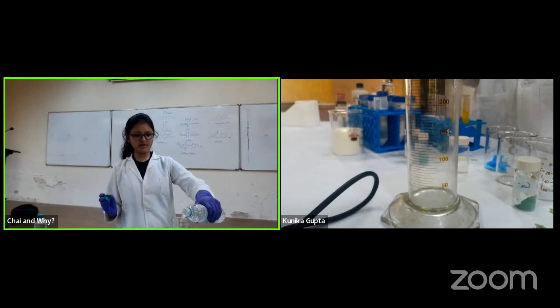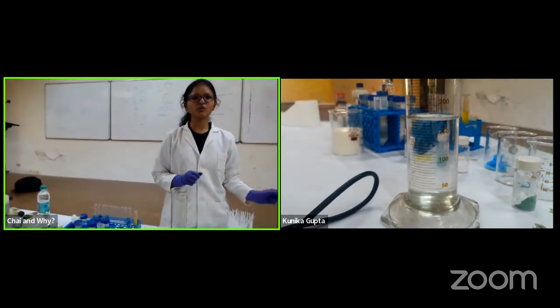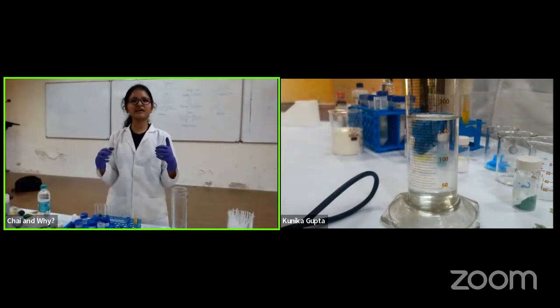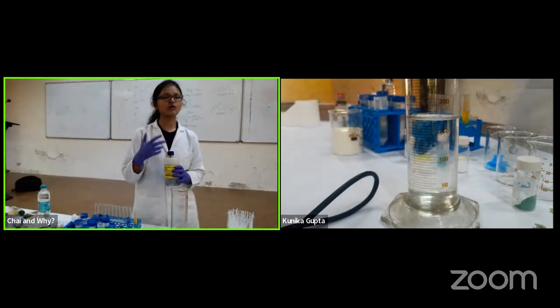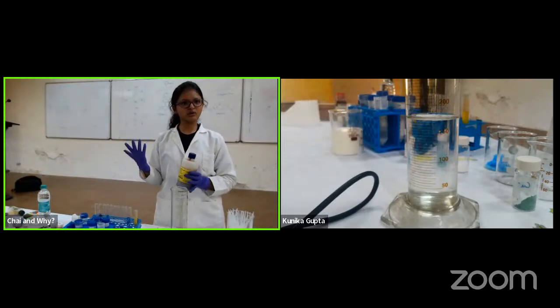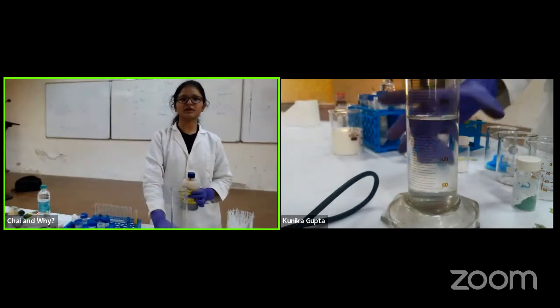Okay, so now I am adding water to this cylindrical flask. Now I'll add an indicator to it. So you know what an indicator is? In general, an indicator is something which will indicate something. Here I have a pH indicator which will tell me the amount of acids or bases we have, like a balance sheet of an account, where you will know how much has come in, how much has gone out. So this will tell me the actual amount of protons in it.